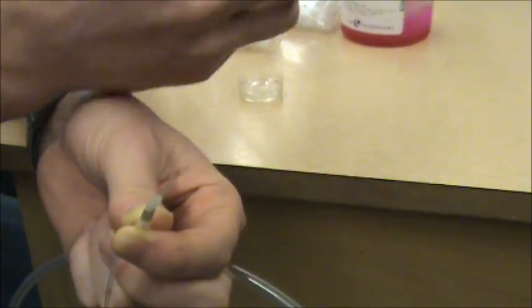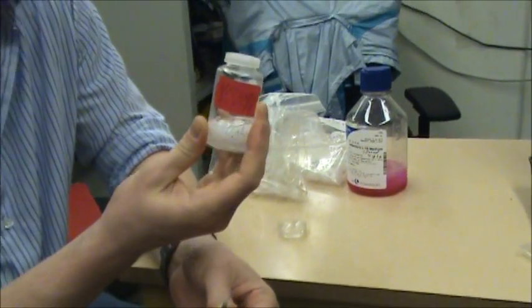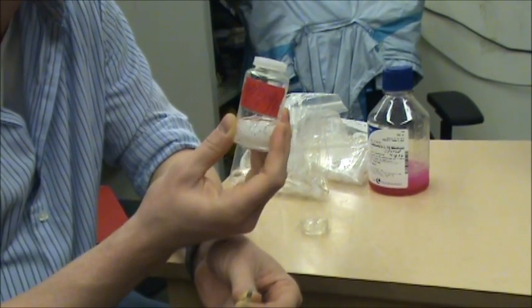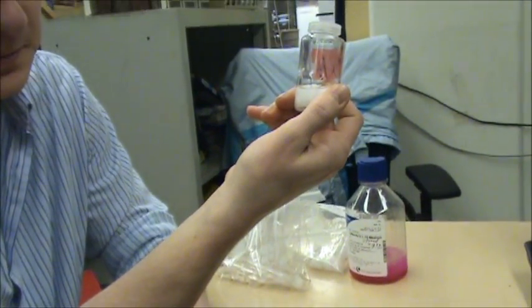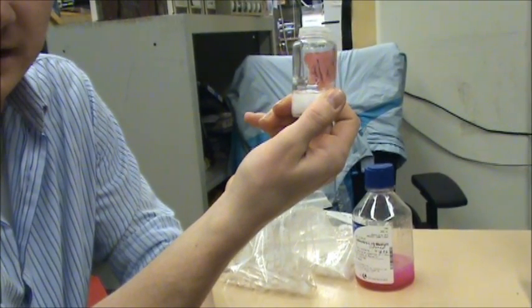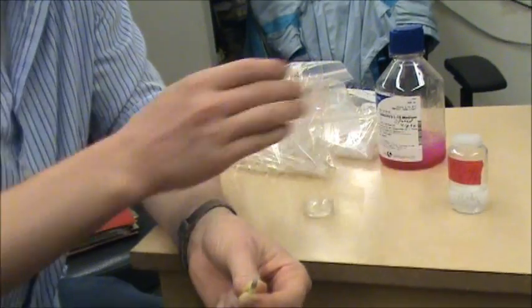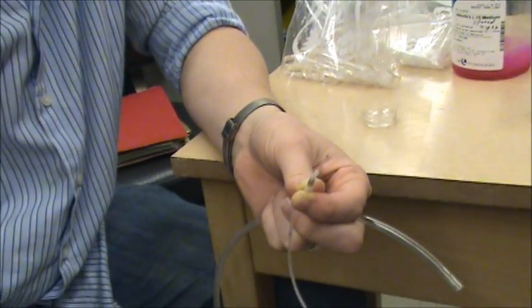And we want to pull out several of these and store them inside of 70-80% ethanol with cotton in the bottom like this. This keeps the tip from breaking and keeps the tips nice and sterile. It's best to have these pipettes that don't have a filament so the cells don't get stuck in there.